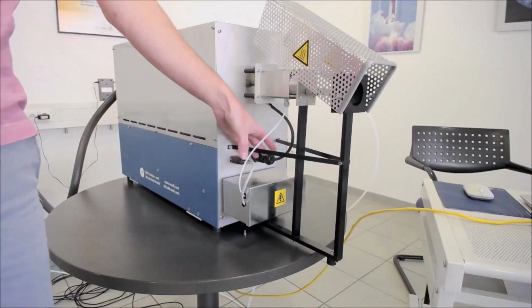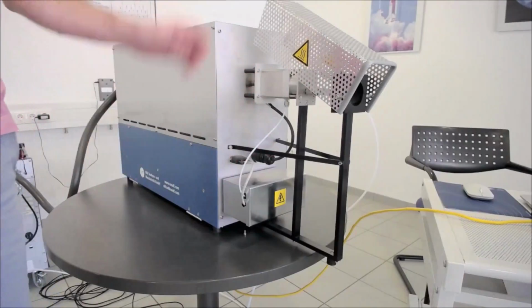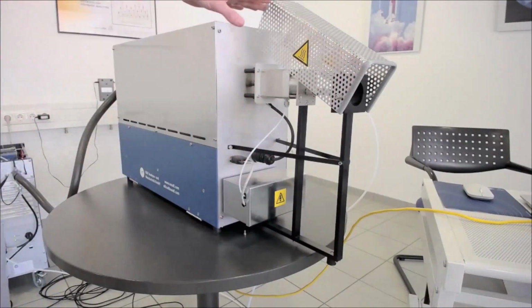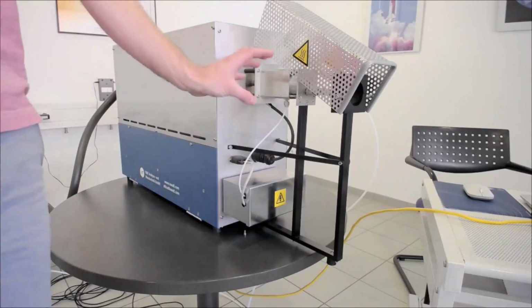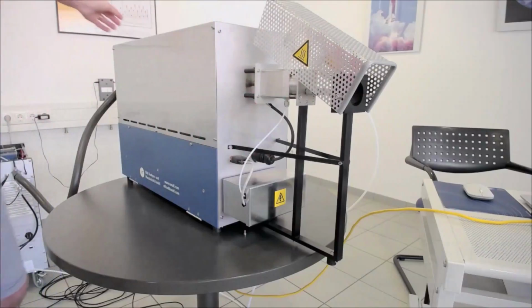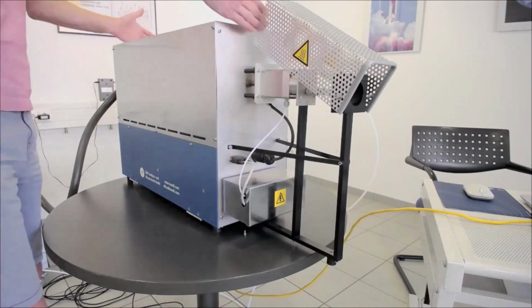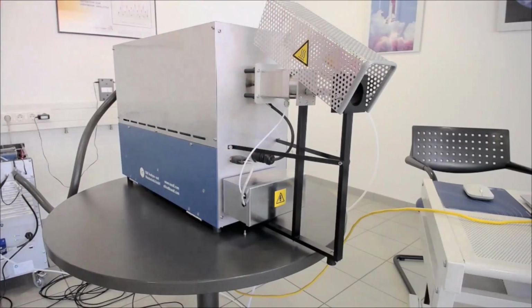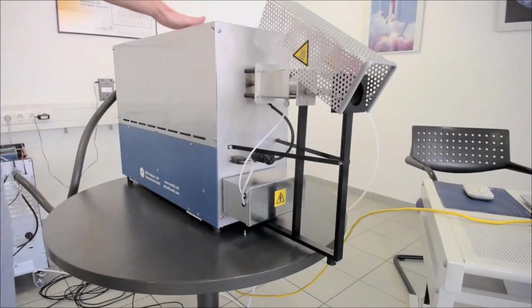Secondary connection we have here is again a heating system for this front part. And what we see here, these are all just grids that protect from the hot part. So all of this will be very warm. We have one zone in the front, which is on 200 degrees. We have another zone in the back, which is 150 degrees. And here the main part will be at 1150 degrees inside. So you can still put your hand close, but it is very hot, so take care of that.